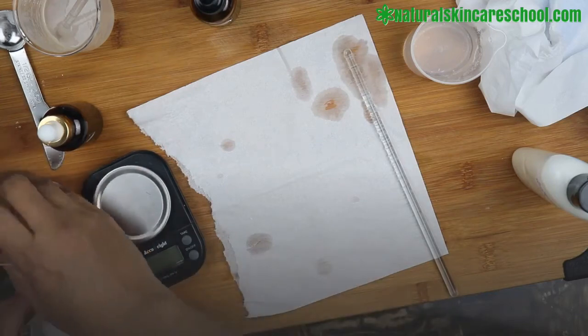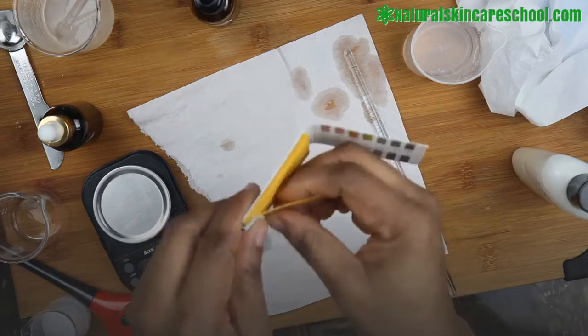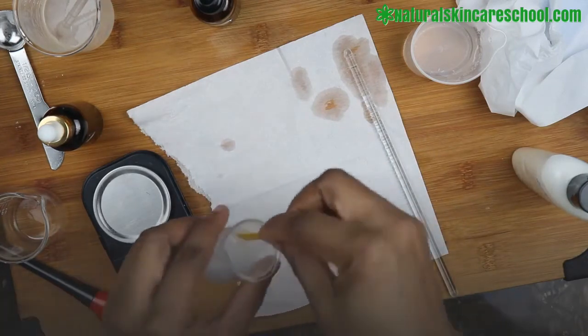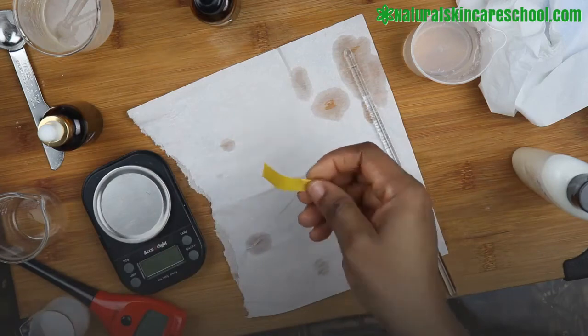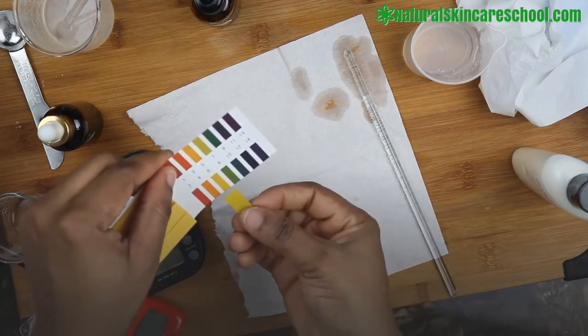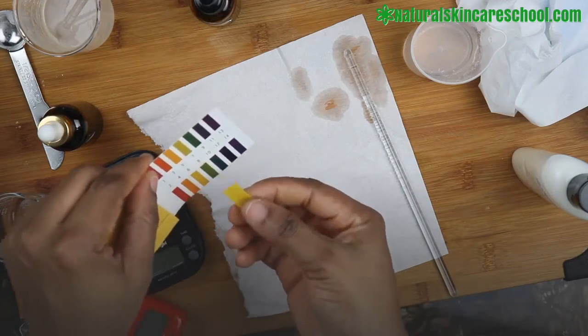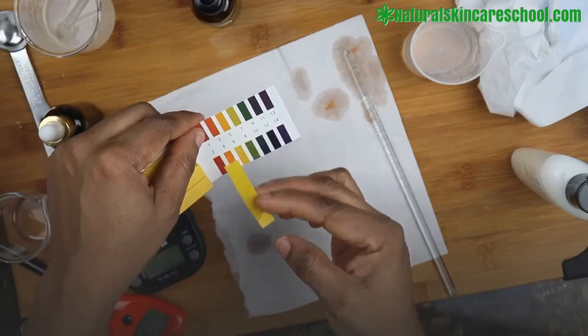Paper strips are not the best for a professional formulator. I just want to show this to you. They're not the best because they won't give you accurate readings. You see, we don't know which one is which. This is not what you want to do.